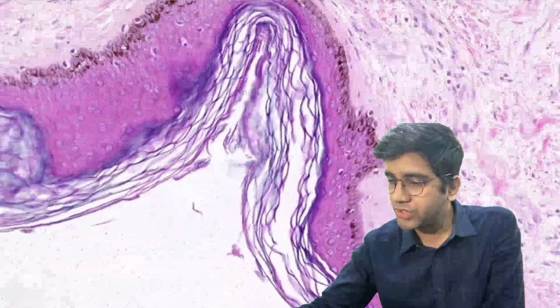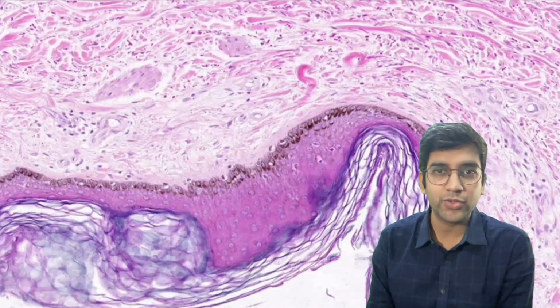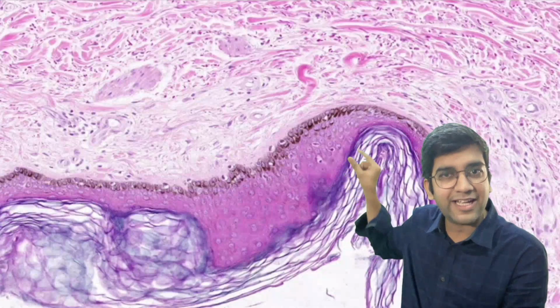Okay. So that's just about the epidermis. This is a trial run for me to see how well it works. If it works well for you, good. I don't have a pointer for now. Maybe in future I'll try to incorporate some pointers so that I can point exactly at what they are. Fine. So do put in your comments on how it is, and let's learn more and more things together.